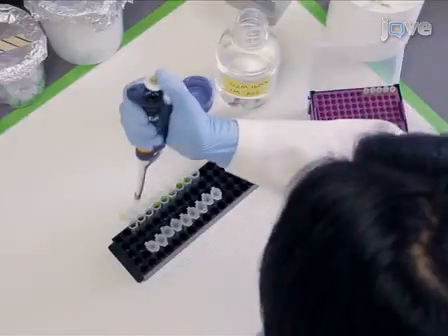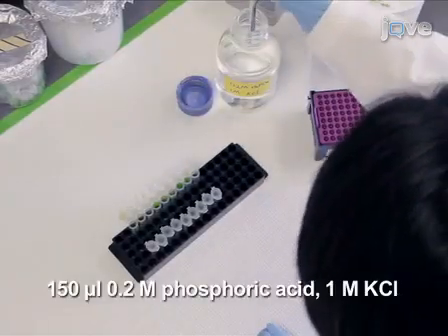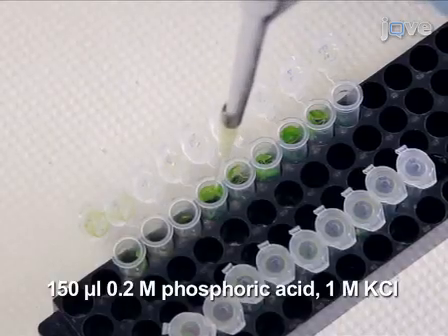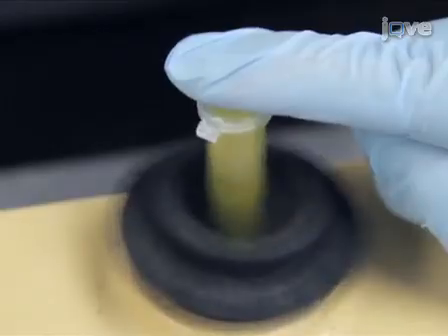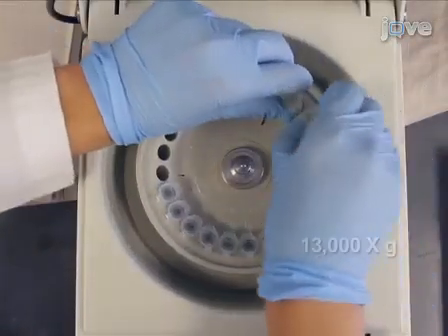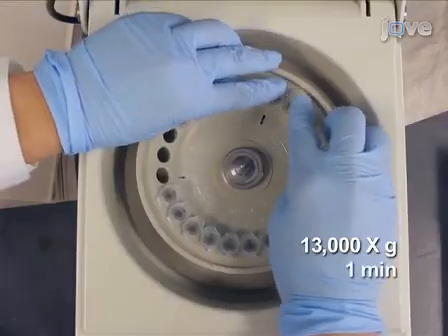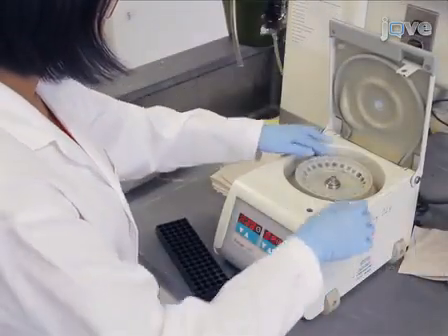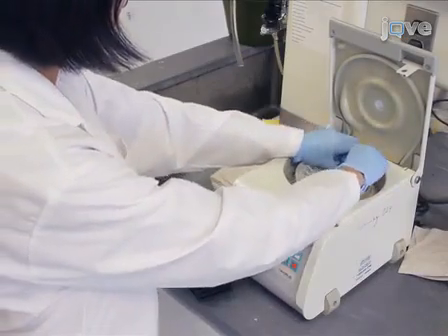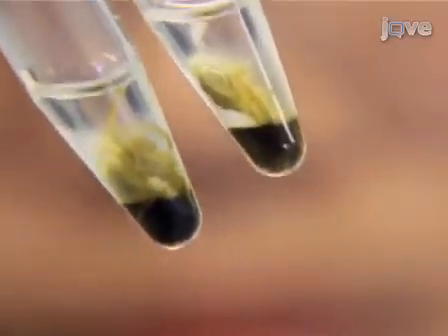Next, add 150 microliters of 0.2 molar phosphoric acid, 1 molar potassium chloride and vortex briefly. Centrifuge the sample at 13,000 times G for 1 minute at room temperature. Lipids dissolved in the lower chloroform phase will be spotted onto thin layer chromatography plates.